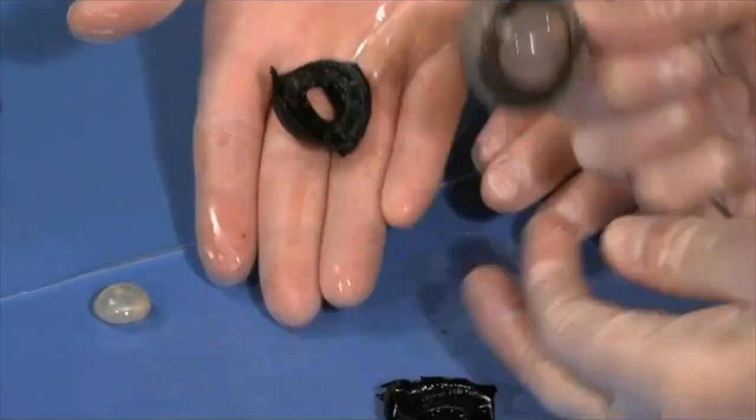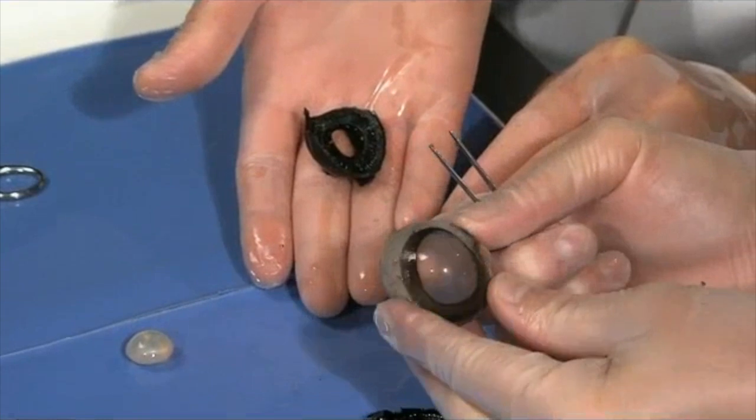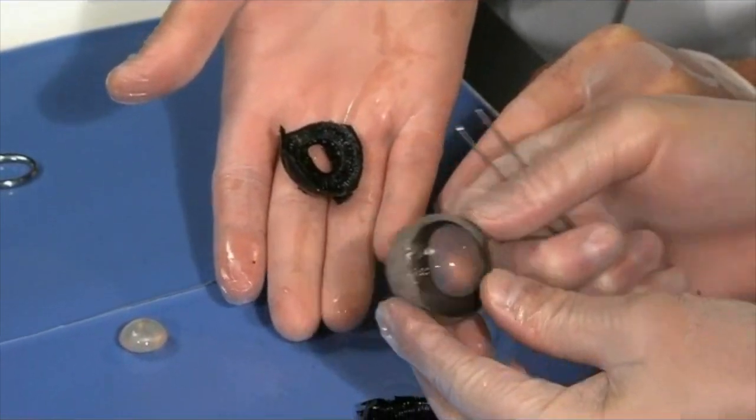And now you can see how transparent that cornea is. You can see my finger through it. So light enters, passes through the cornea, through the opening, the pupil, and in through the lens. The lens then focuses the light on the retina, and those signals are sent to the brain and interpreted as vision. So not really complicated, and yet it works fantastically. It works extremely well, and the level of visual acuity that most vertebrates, in particular mammals, have is amazing.